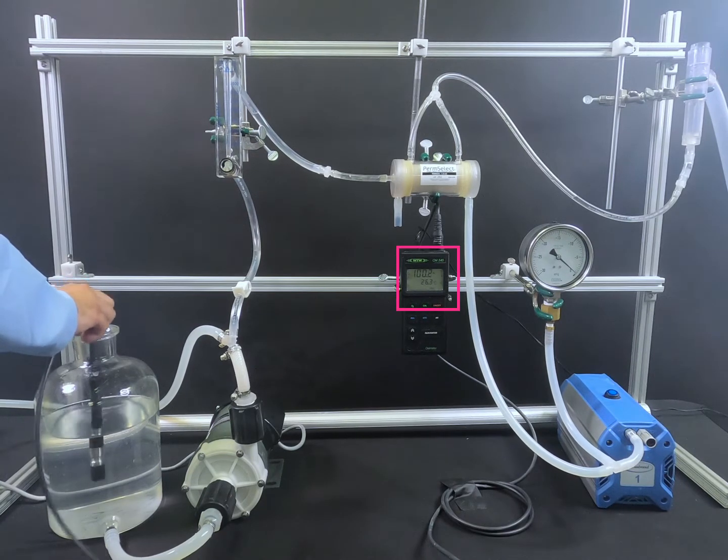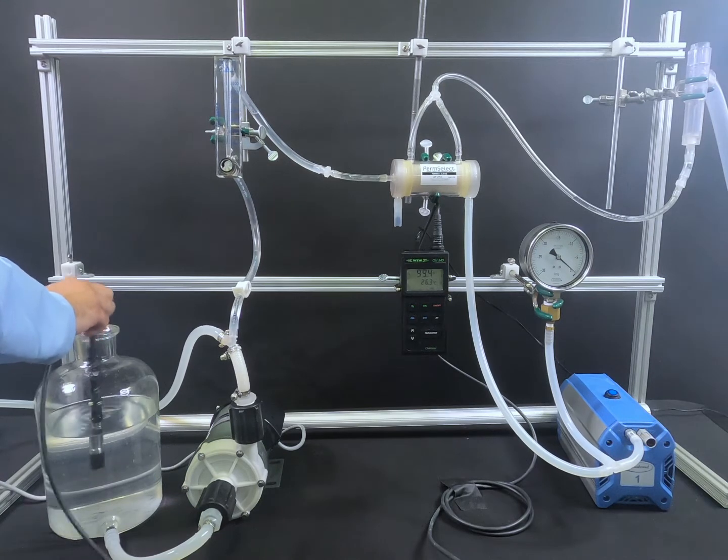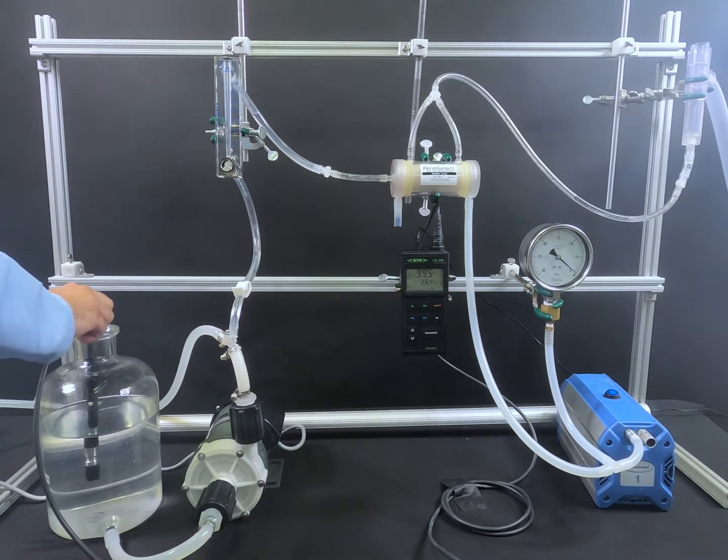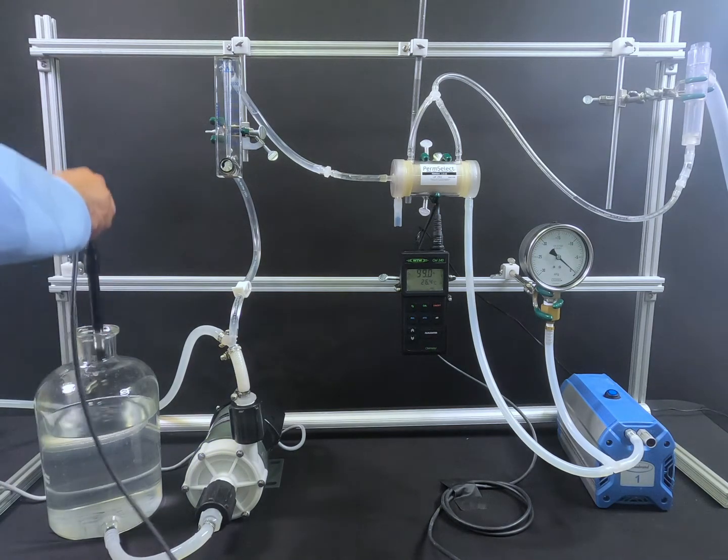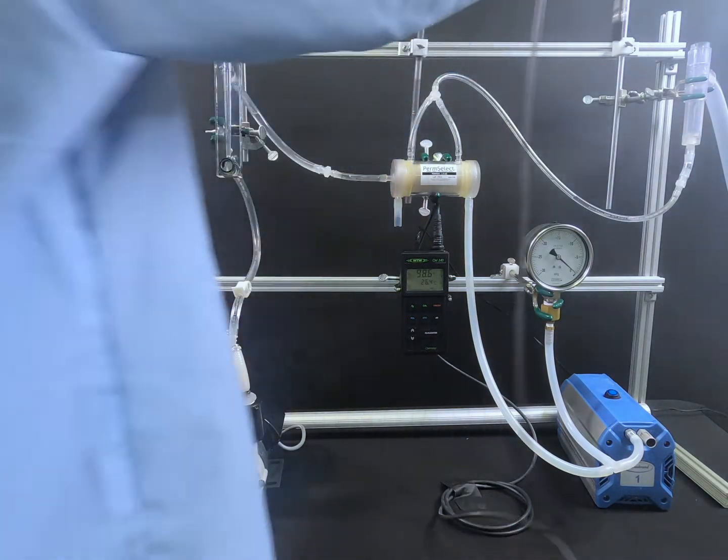The dissolved oxygen percentage currently reads about 100% dissolved oxygen. The probe will now be moved downstream of the PDM-SXA 1.0 to demonstrate the effectiveness of the degassing application.